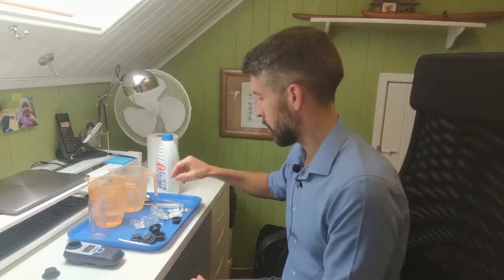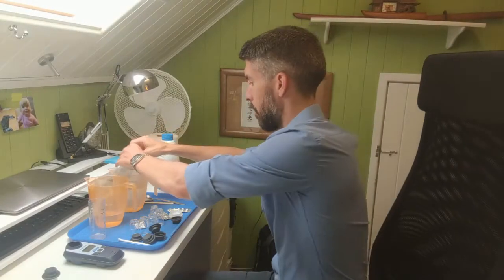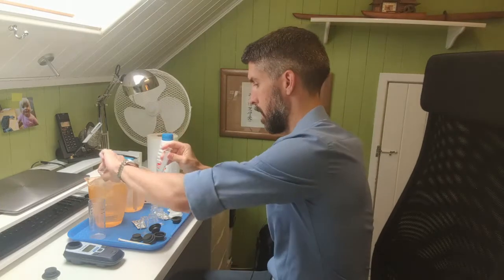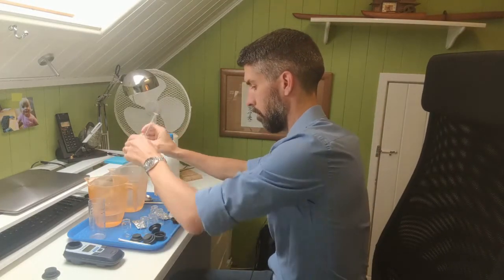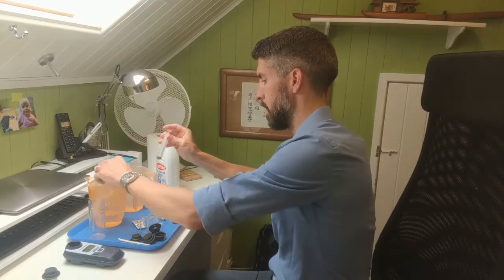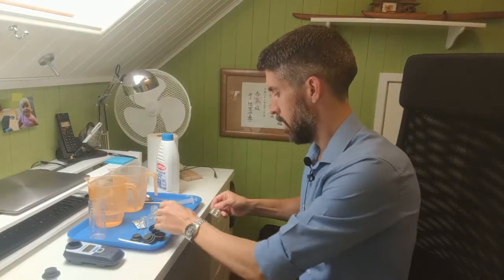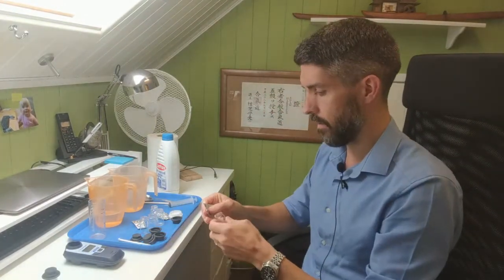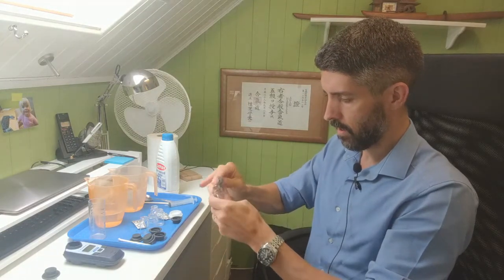So for the actual test itself, what you do is draw off some water and rinse out a test tube a couple of times. And what you need to do is just leave a few drops of water in the bottom, and then into that you add a DPD1 tablet, without touching it with your fingers, which would taint the sample. And have a look at the colour. It's got a deep pink colour, so we know that there's chlorine in there.